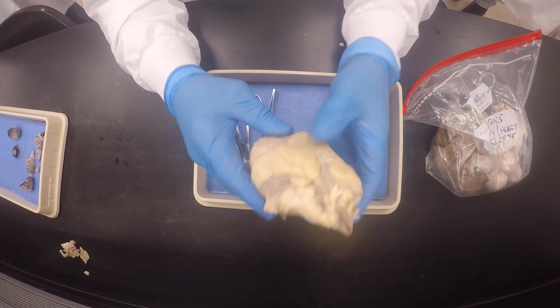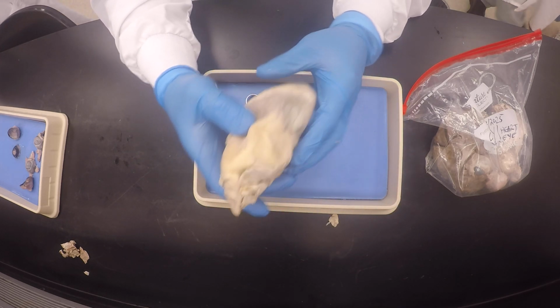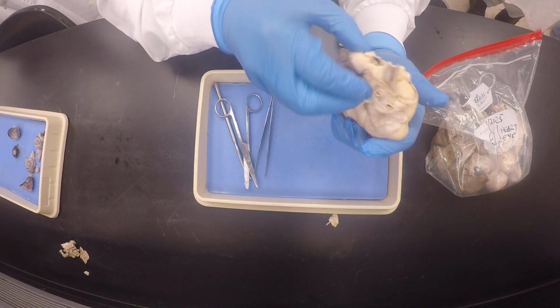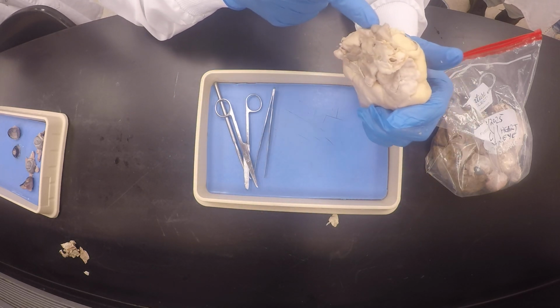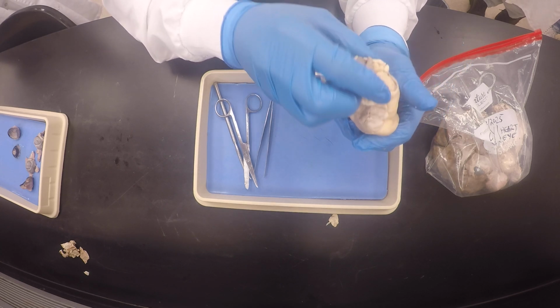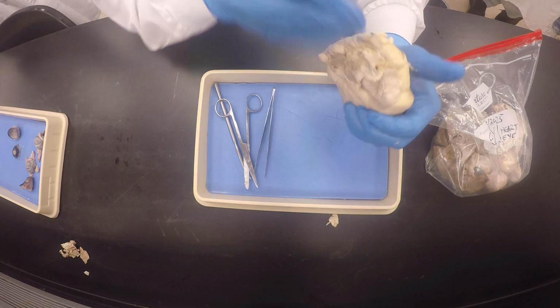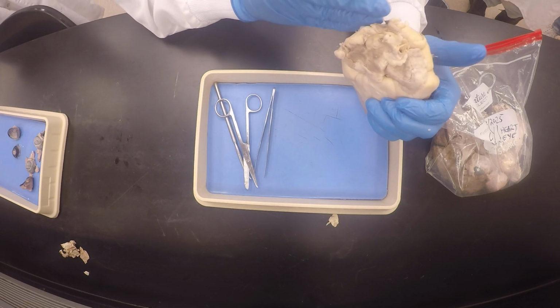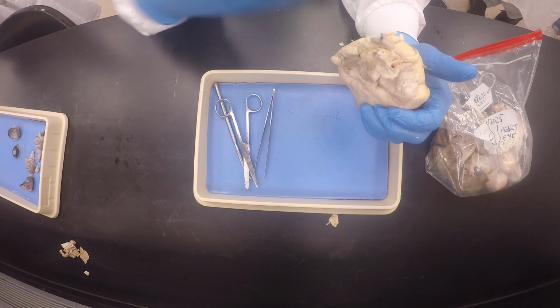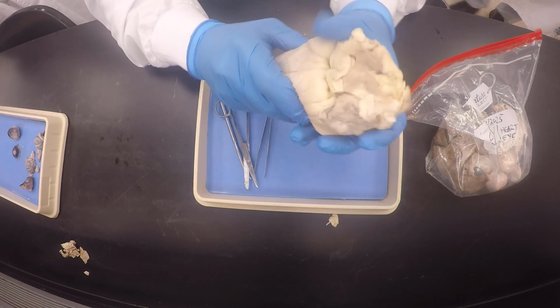Okay, my good friends. So what I'm gonna do is cut. Make sure I cut like this, and I want to cut in the middle, so that I can cut through my aorta in the middle like this. I'm gonna use my aorta as my guiding point, because I want to make sure I cut through the middle of this, you know what I mean? So that I can see the aortic semilunar valve. If I'm too much on one side, sometimes I miss it, and then I won't be able to see any of the structures that I want to see. Okay? So this is why I'm doing this.